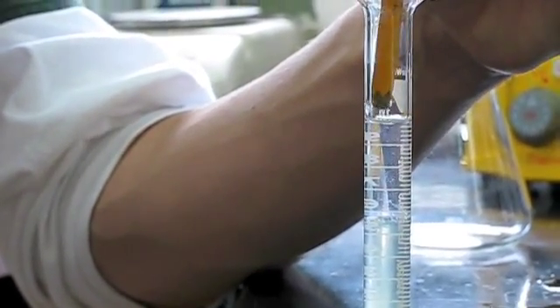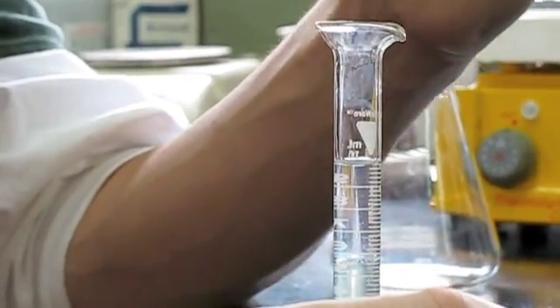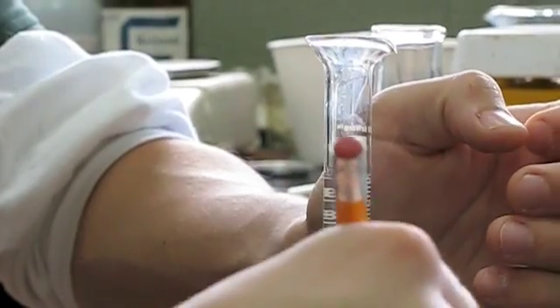And there it comes up. There it is. And it actually worked this time. It looks better if you get a tinier stick, but we can probably get more out. But at least it's solid now.